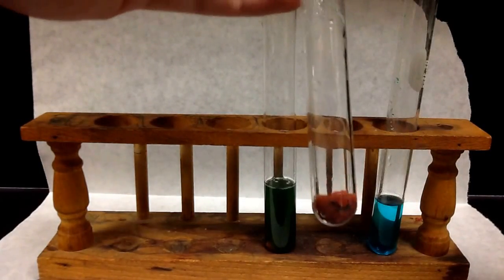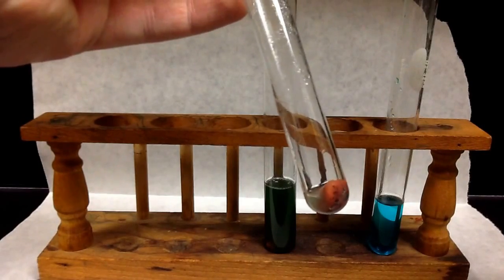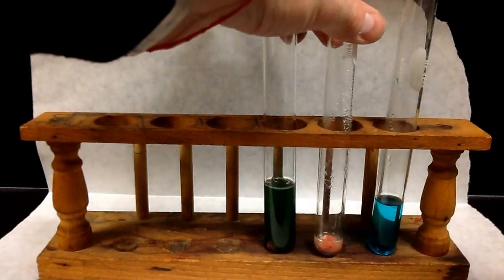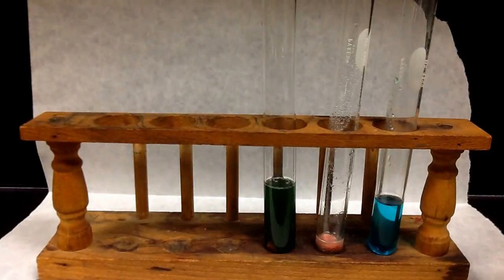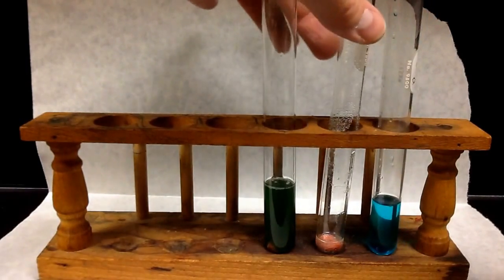So now, we can see hopefully that this has a nice reddish brown color to it. And you actually made copper. So the copper that was in the solution before that gave us that nice green blue color here is now copper metal.